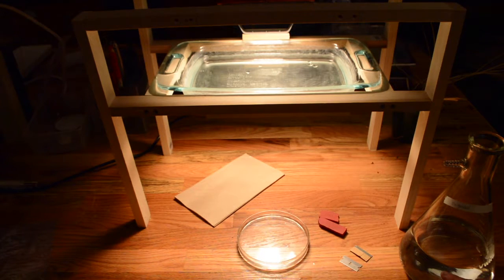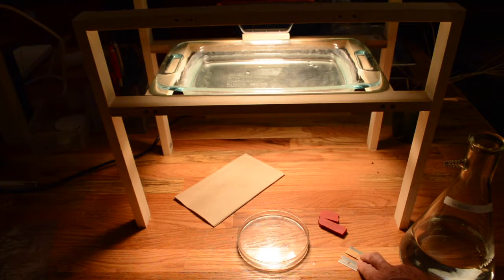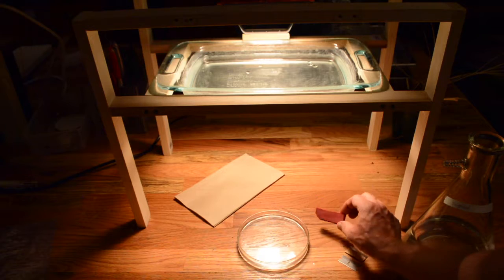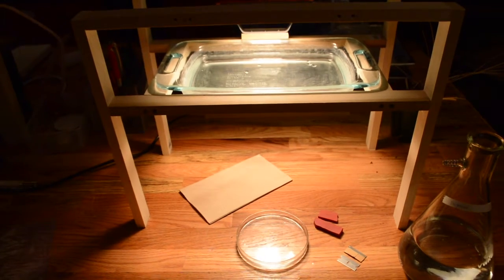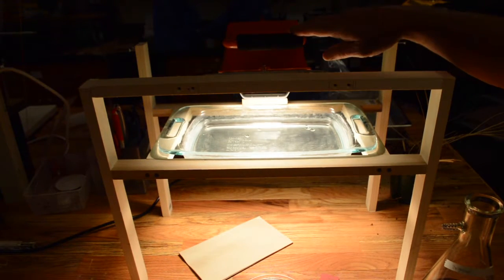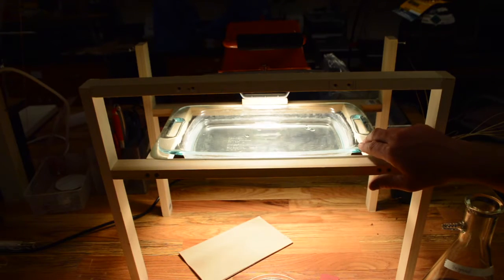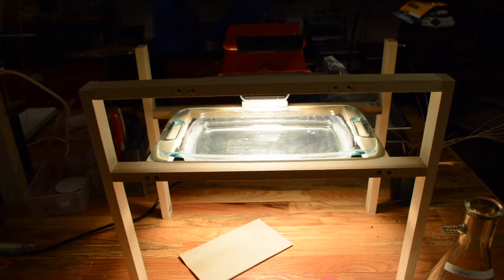Now, in addition to the water in the petri dish, I have a larger flask here filled with the same water, because between measurements I like to put fresh water in here so it's always clean water. I like to have a bunch of razor blades on hand because I always want to use a sharp razor blade when cutting my leaves. And then I use these rubber pads to make some of my cuts on. Then I've just got some towels here because inevitably I will spill water and everything will get really wet. Then the last piece of the equipment here that's important is I've got this light source here. So this is just the halogen work light from Home Depot that I purchased. Then I built this wooden stand to hold this glass casserole dish that's filled with water. And this just acts as a heat sink so that the heat from the halogen lamp doesn't heat up the leaf or anything else I'm doing down here too much. I just want to point out that the light source is important because some species are sensitive to light intensity. So what we do is we just standardize the light intensity of all of our measurements so we minimize the potential effect of light intensity on our measurements.